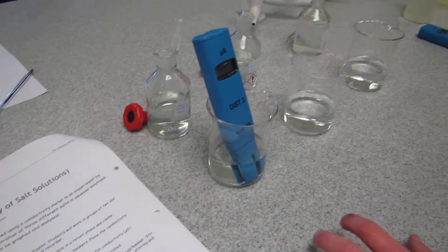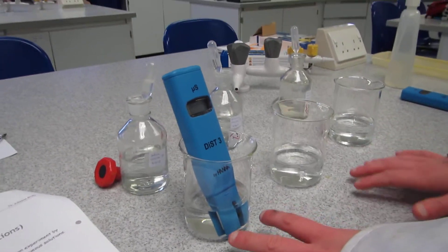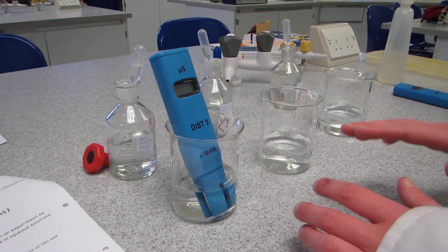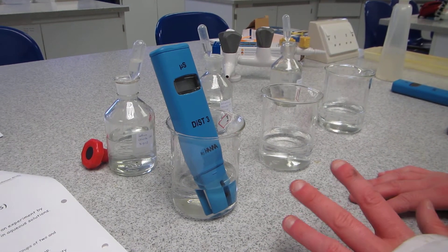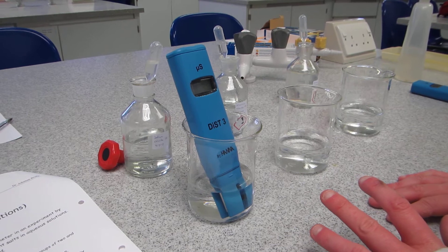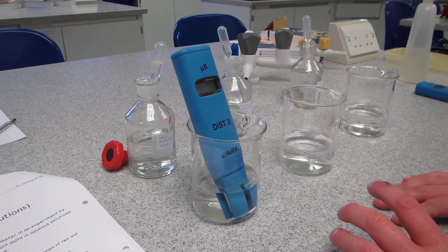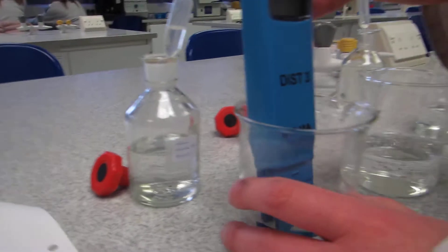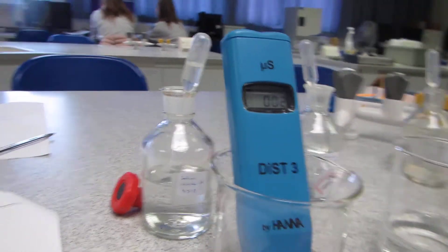To measure the conductivity of salt solutions, I've measured out 100 milliliters of water into three separate beakers. We're going to look at how adding sodium chloride, aluminium chloride, and calcium chloride at one molar affects conductivity. First, I'm going to work out the conductivity of our plain distilled water.